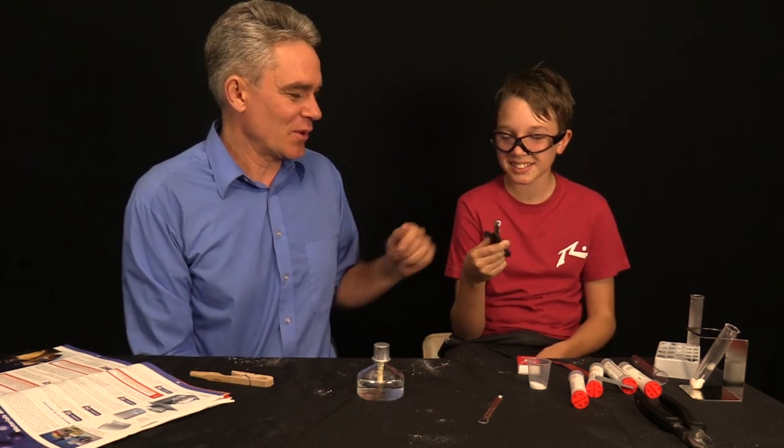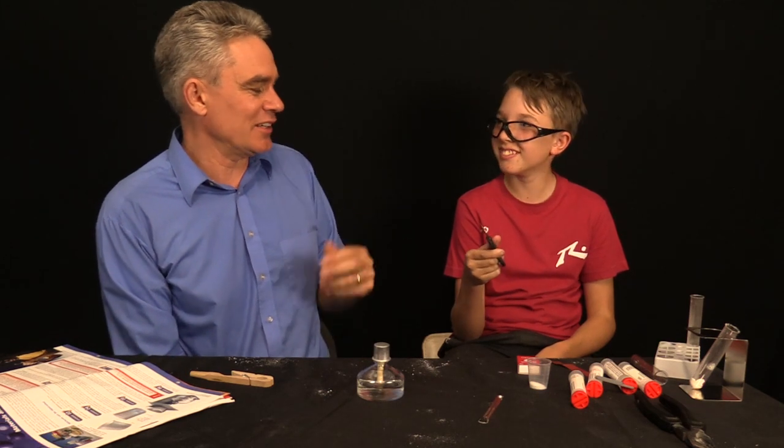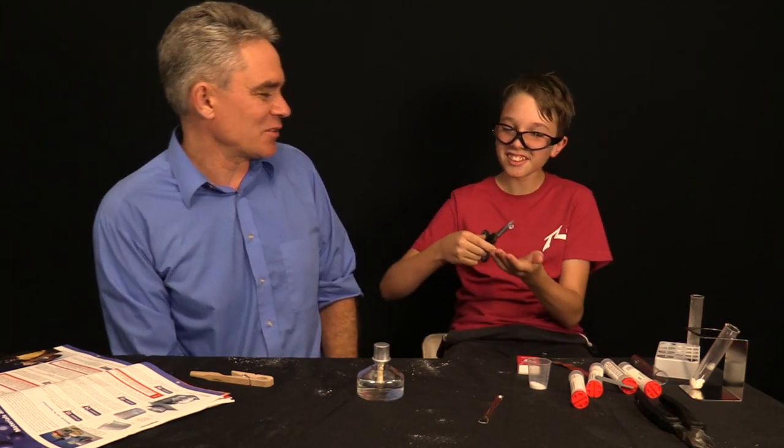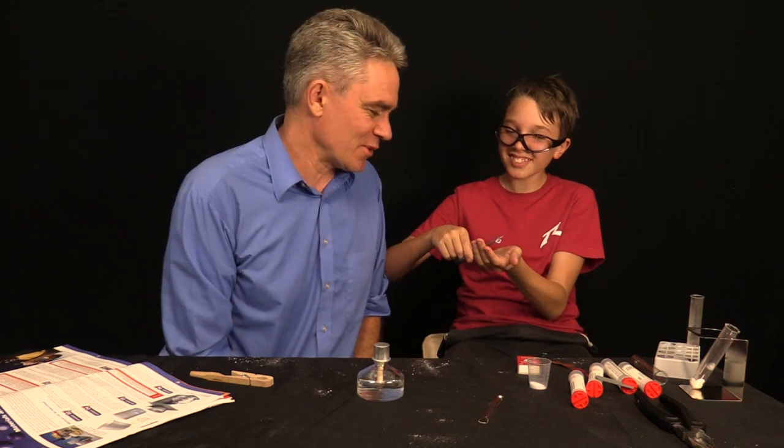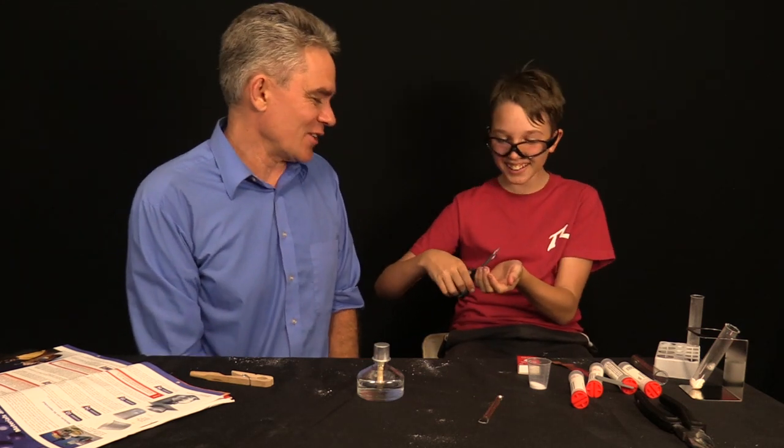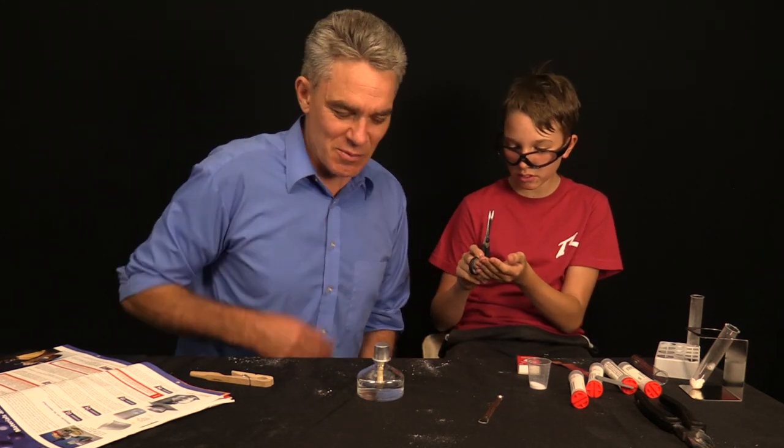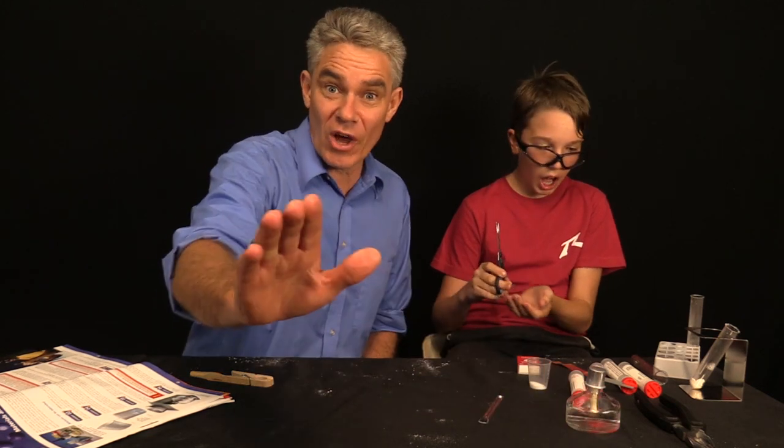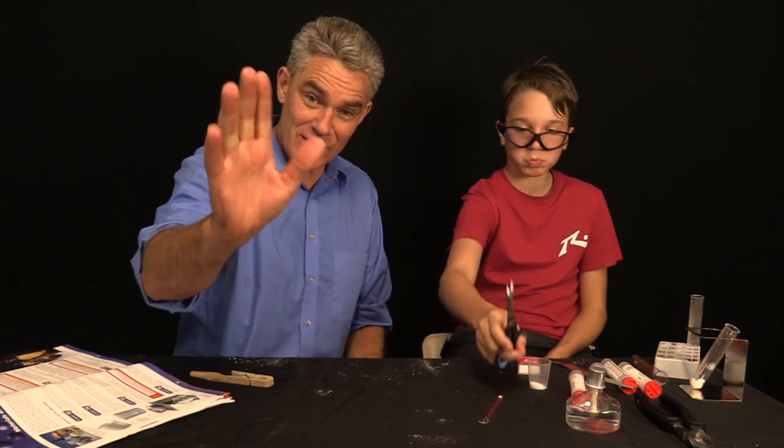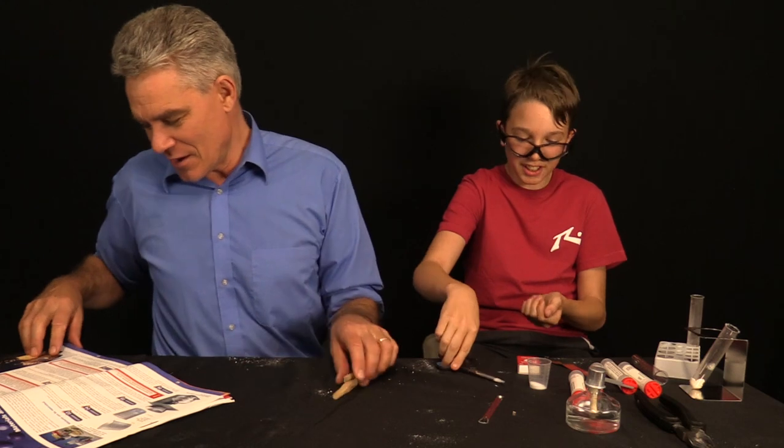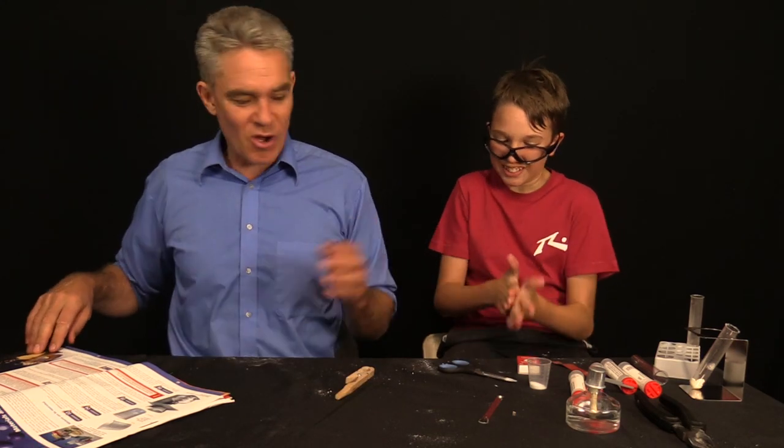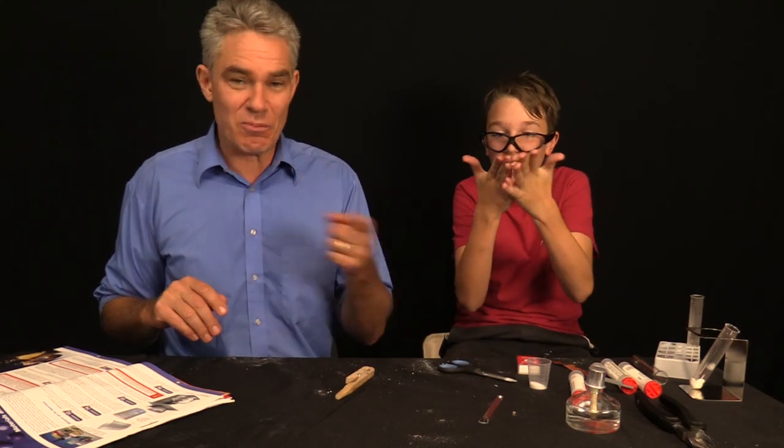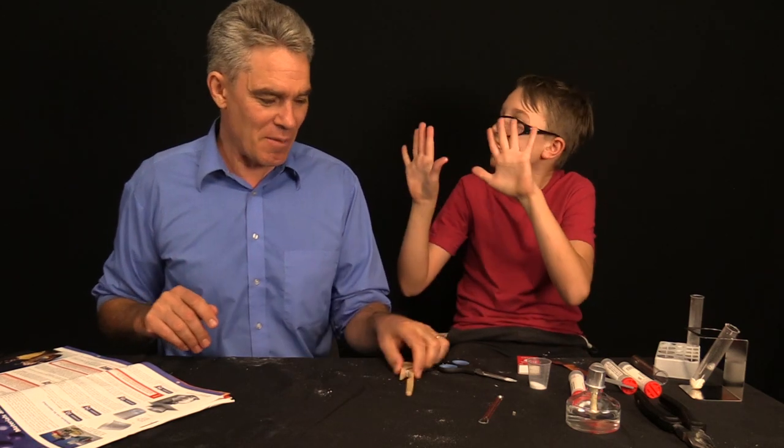Now, don't you drop it onto my tablecloth. So, it produces a white powder. And what's that white powder called, Sam? You burnt magnesium in oxygen. What do you think the white powder is? I forgot. Magnesium oxide. All right. Where do I put this? Maybe you could put it in your sunscreen lotion. That's why they call it zinc cream. Zinc oxide. But magnesium oxide probably do something similar. So, that was experiment nine.